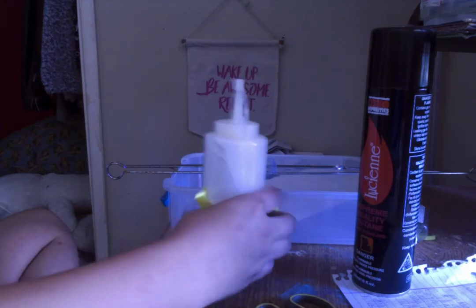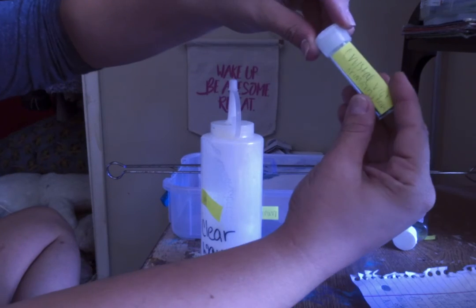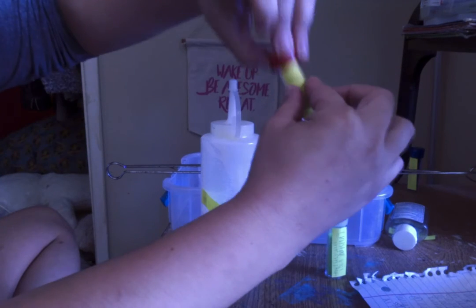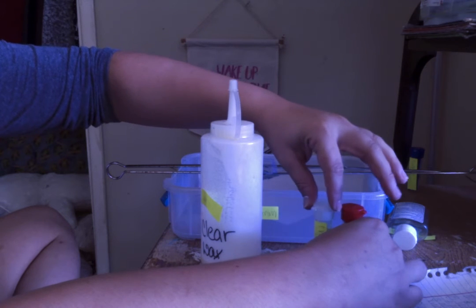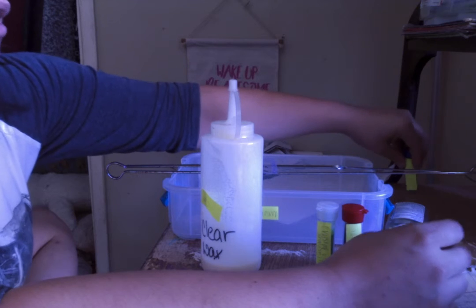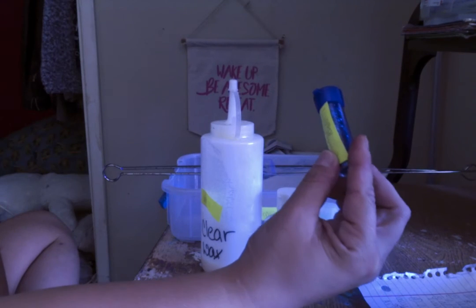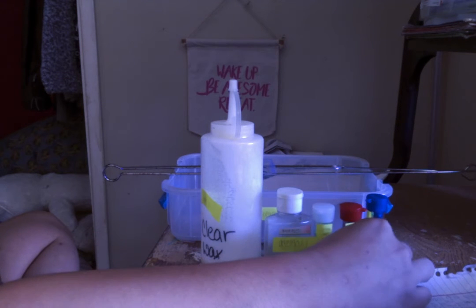So the parts of the gram stain include the water, the primary stain crystal violet, which turns it purple. The iodine, which interacts with the primary crystal violet and will help the purple stay in the cell's walls and structure. And then you have the alcohol or decolorizer. And then lastly, your counterstain or safranin, which will turn gram-negative bacteria pink.